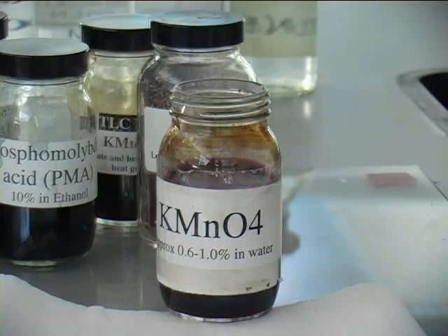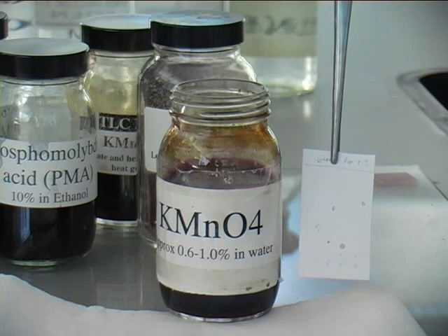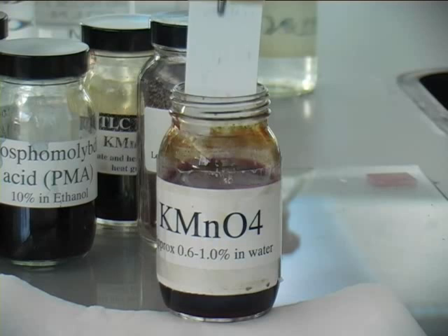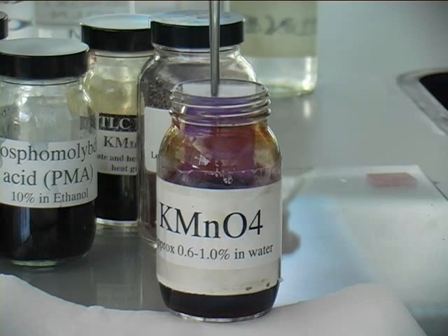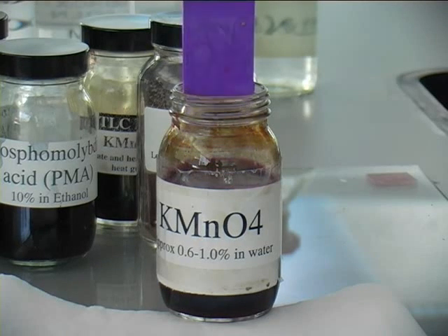Which is the potassium permanganate dip. It's important that you have marked your spots, because after the permanganate dip, you won't be able to see it under UV anymore.